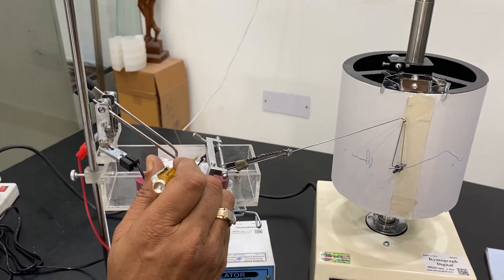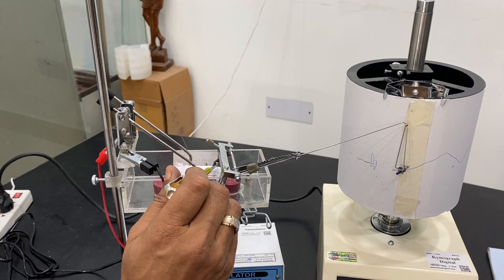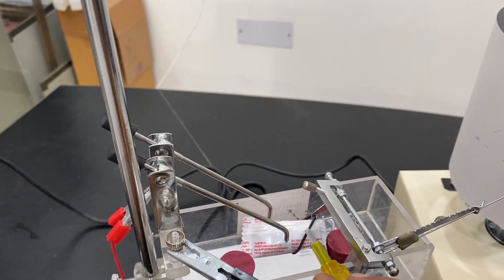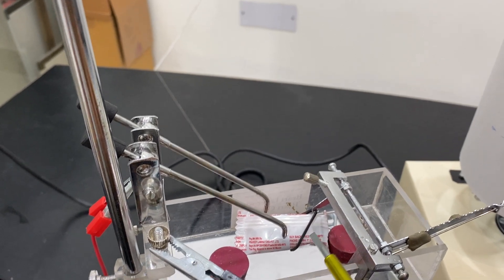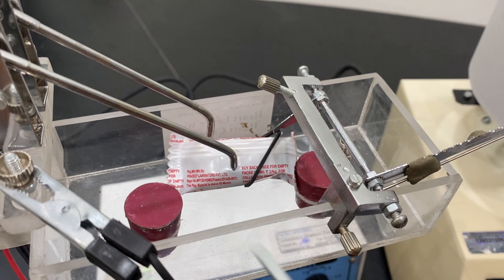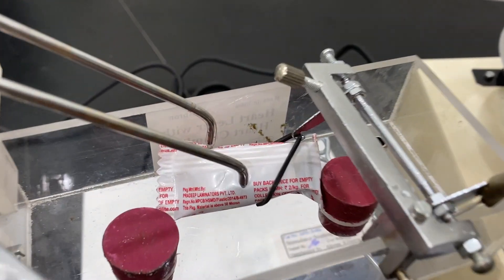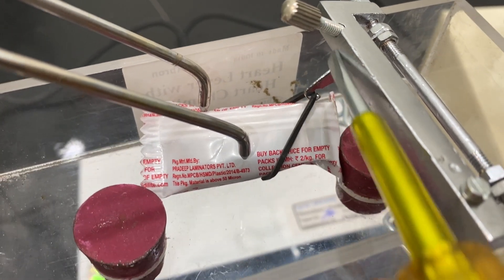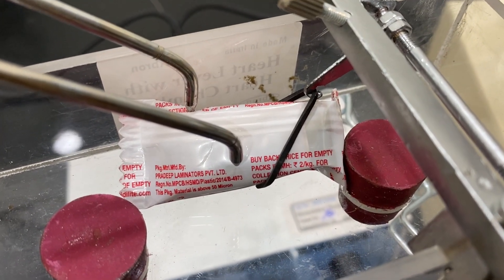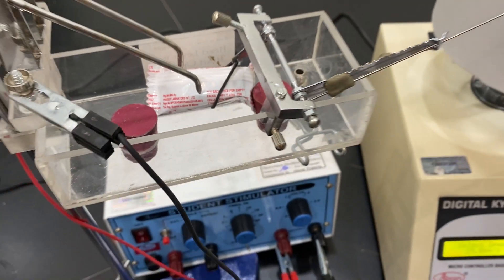From the front, on the lever there is another wire which I have put a rubber band. Or you can put a clamp or wire as per your experiment. See this, there is a hook here, notch on which you can see. I have put the notch and then as a simulation of the heart.